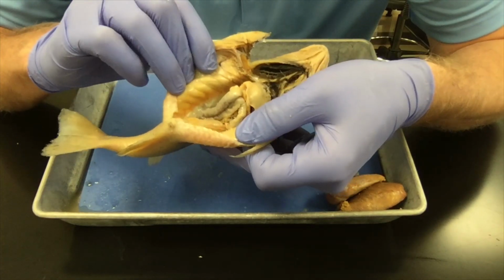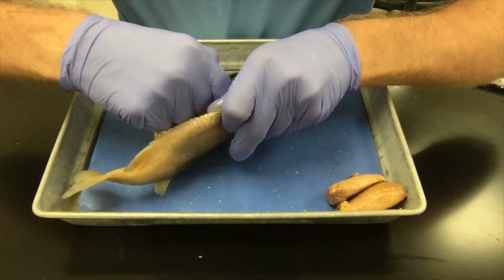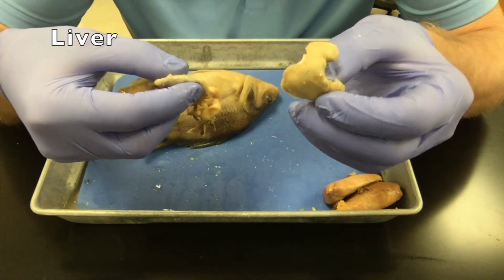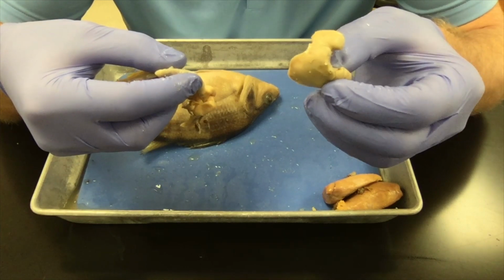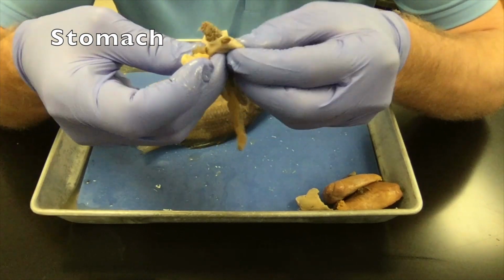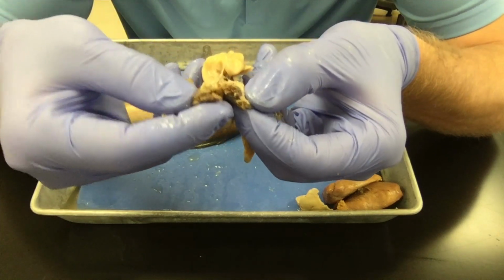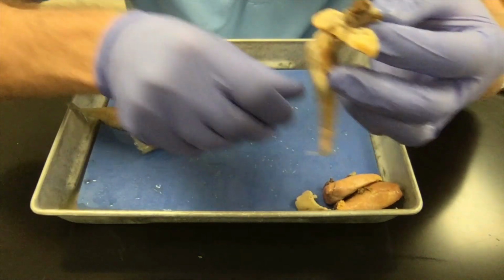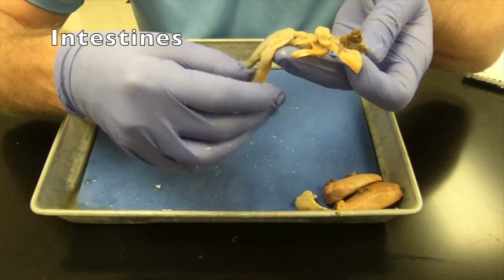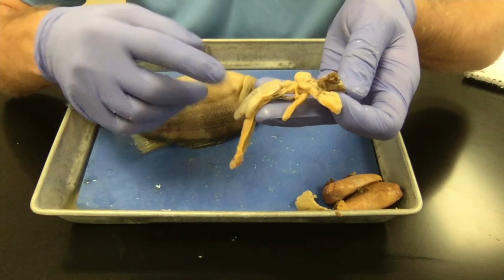Most of the rest of the organs that you see in here have to do with the fish's digestive system. I'm going to go ahead and pull all of them out. We see the fish's liver, which is used to filter blood, but also to produce some digestive juices. You see the fish's stomach right here, which if we squeeze it out, there are some bones of tinier fish ground up inside of it. Pretty nasty. And then just back of the stomach are long, stringy intestines. The intestines are used to help absorb the nutrients that the fish extracts from its food.